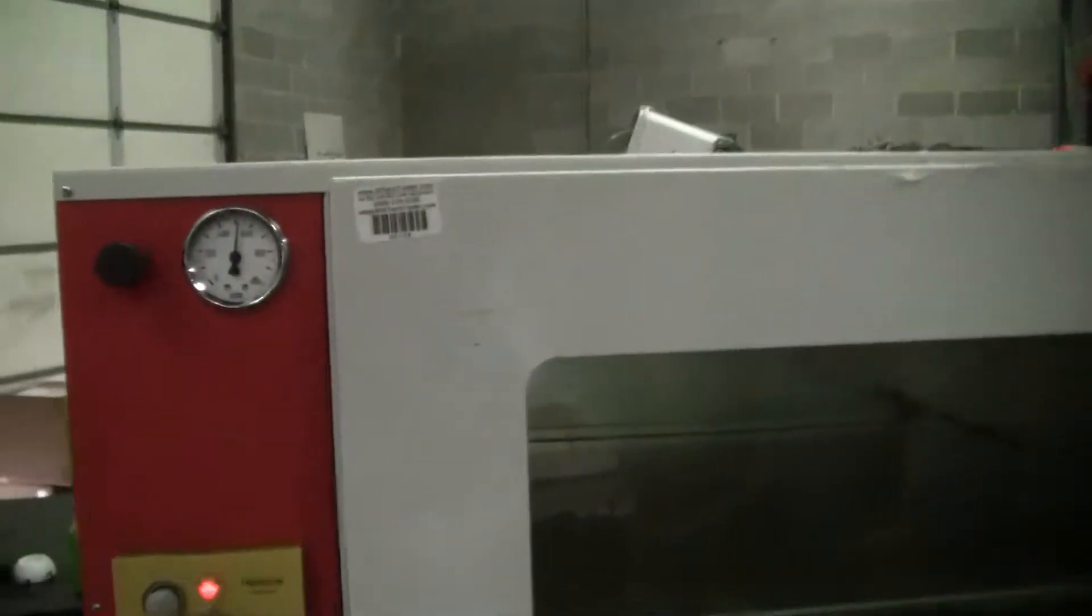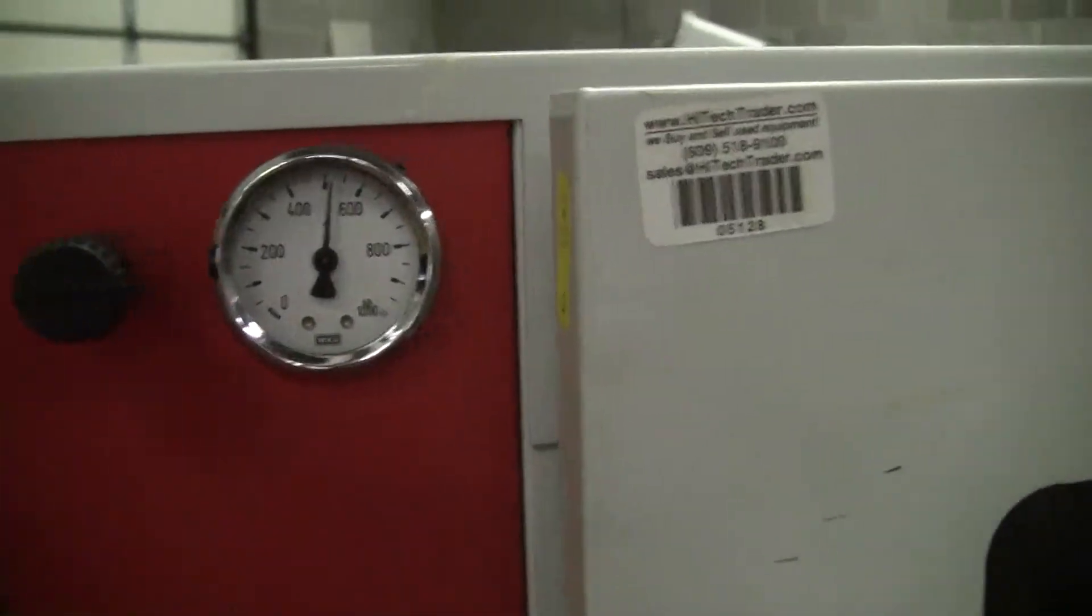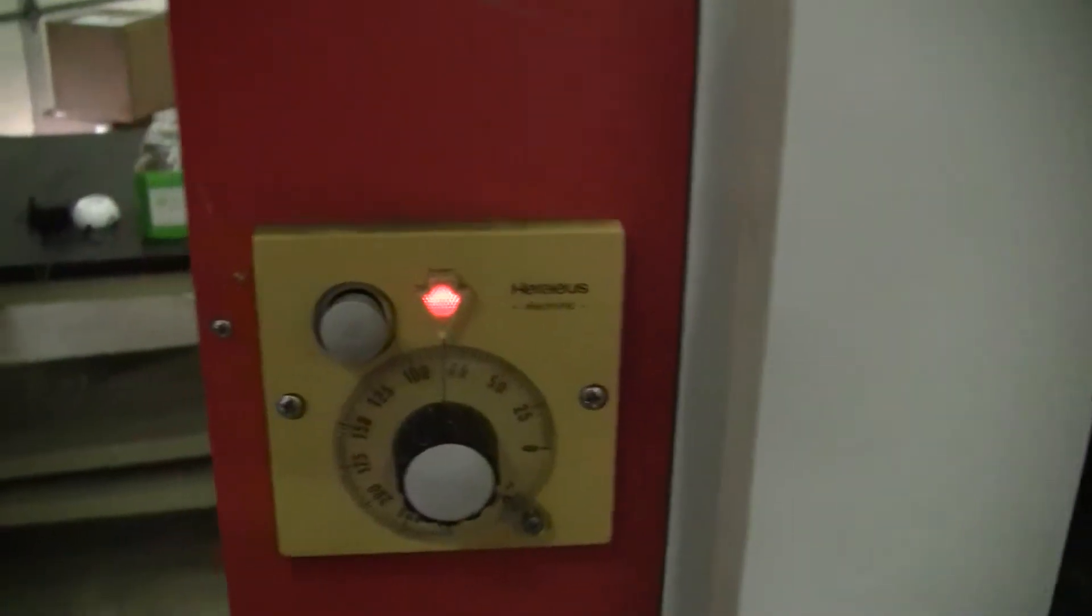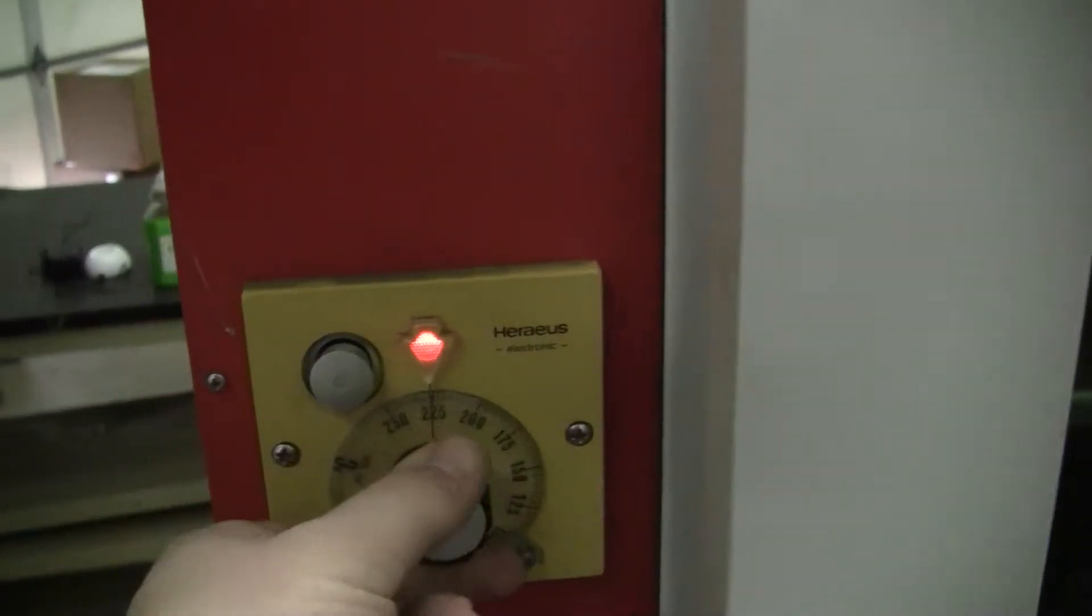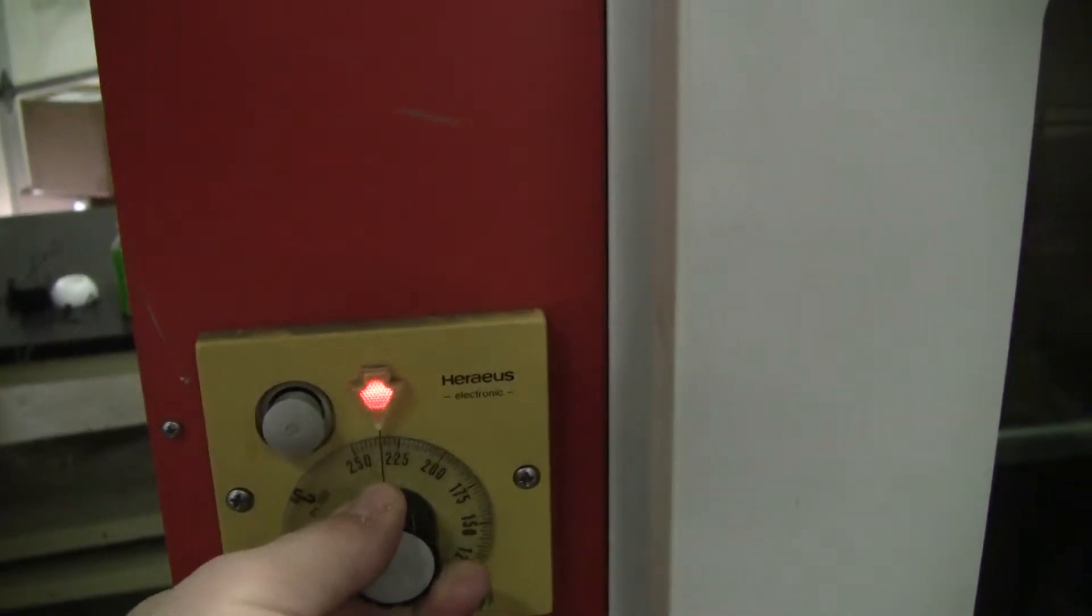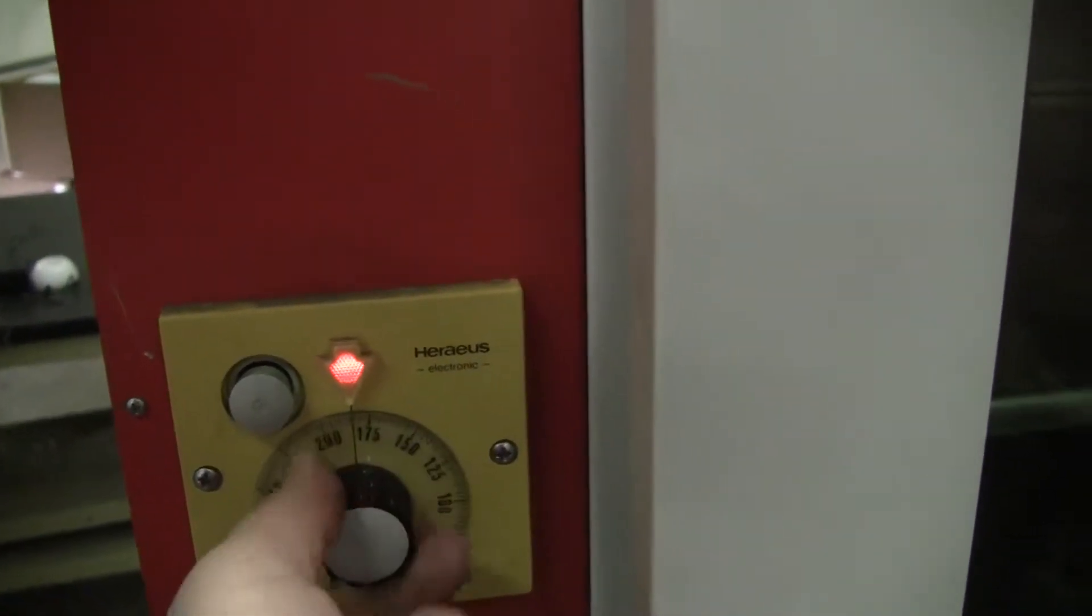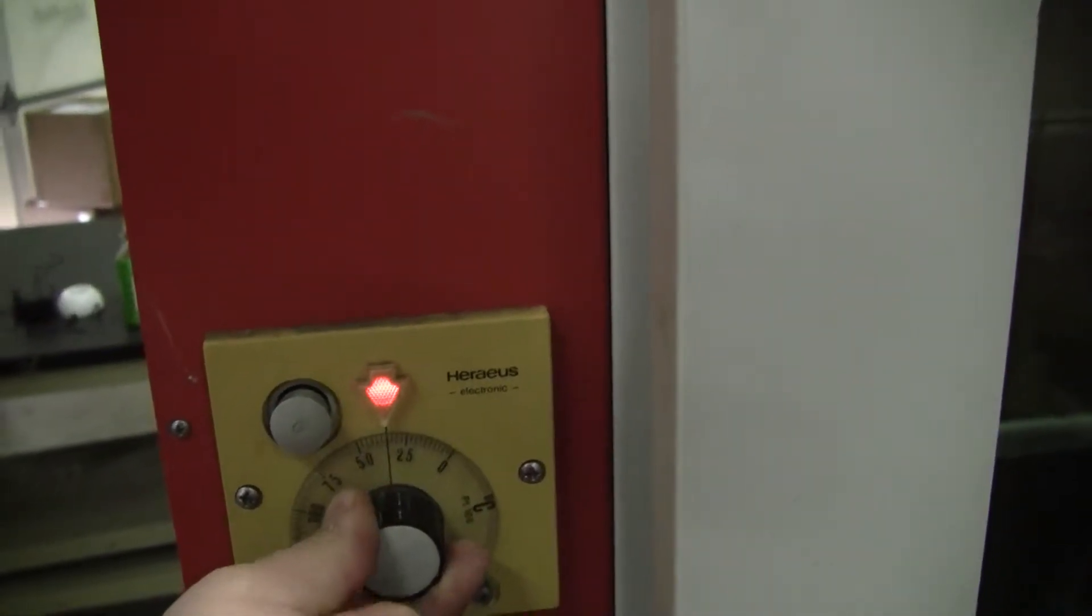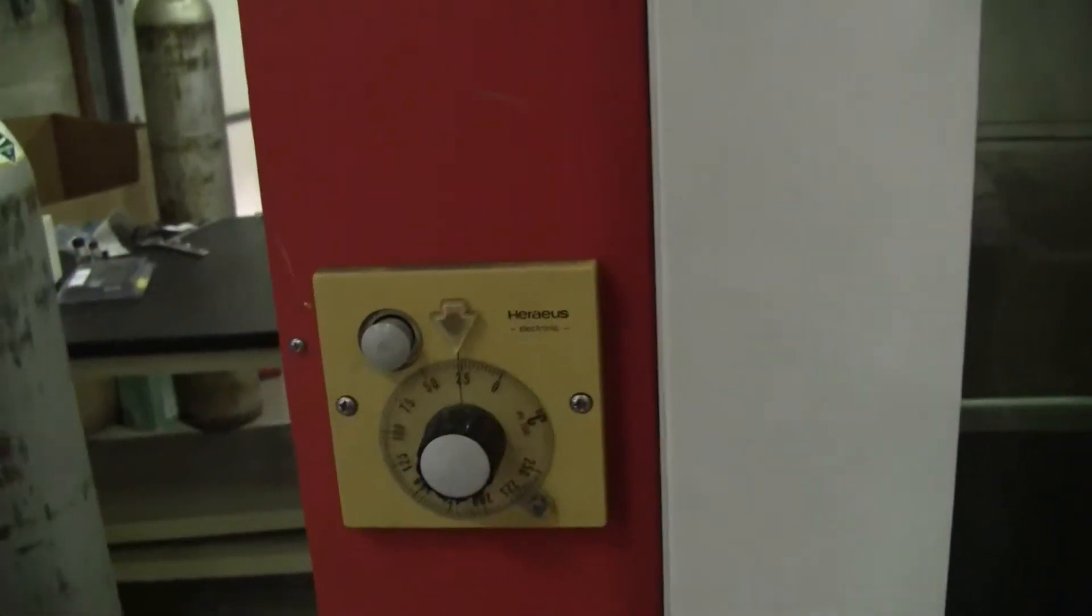It is under vacuum now. Units here are millibars. Temperature control. This unit, at least the indicator, will go up around possibly to the 240 mark, 250. You'll see the indicator light go off in a moment. It gets to the temperature, just like that.